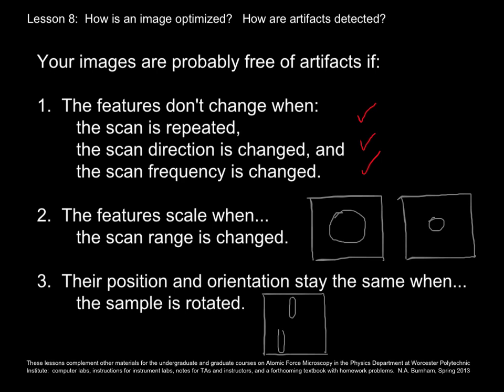So here we have a sample. Features look like this. We rotated by 90 degrees. The features should look like this. And both the relative position of the features should rotate. So this triangle is rotated by 90 degrees. And the orientation of the features should rotate by 90 degrees.